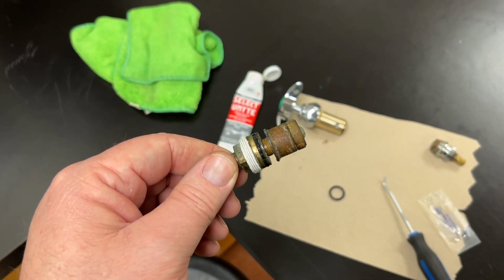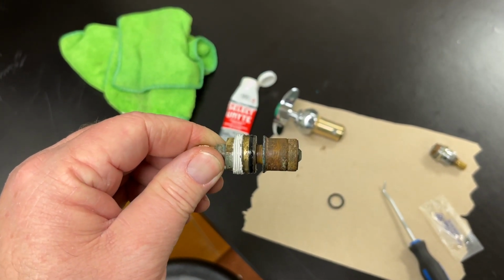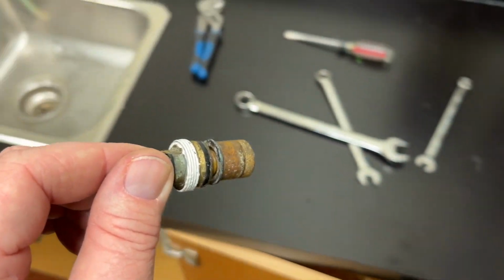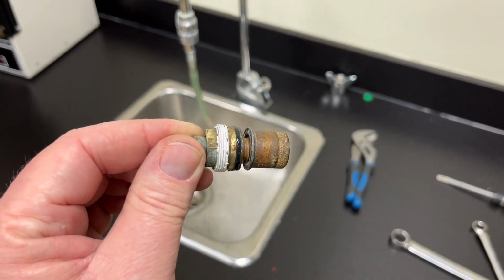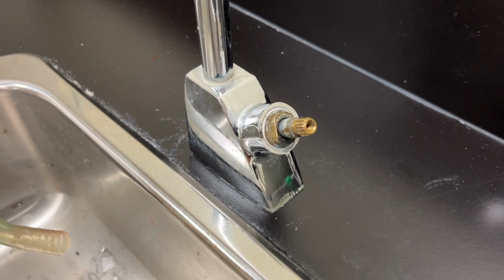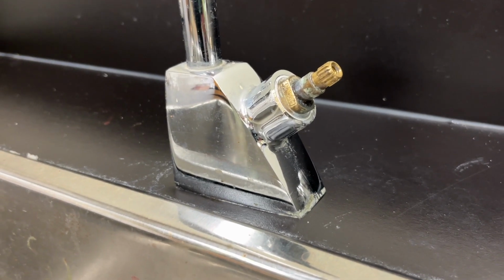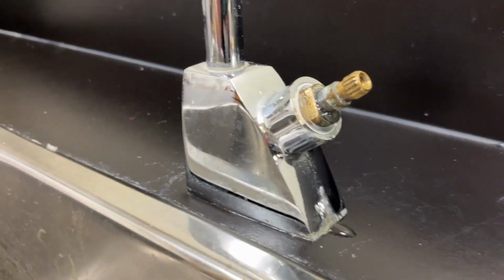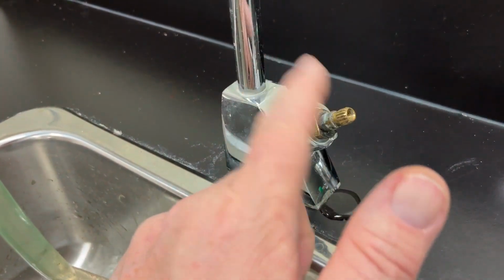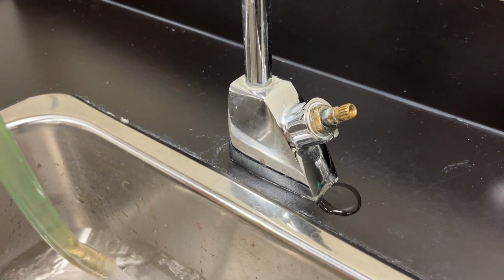So I'm going to try something here. I want to confirm that it's actually leaking through the cartridge and not around the threading. So I've greased up the O-ring, and I've put some thread sealer on the threads themselves, and I'm going to reinstall it and turn the water back on and see what happens. Okay, it's in, and that is as tight as I can make it. And so let's turn the water on and see if we have any seepage. So, I didn't repair this at all. I'd be surprised if I can get parts for this cartridge. These faucets were discontinued a long time ago. So the hunt begins.